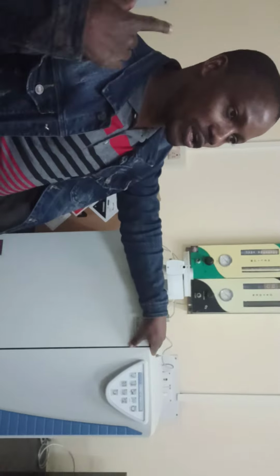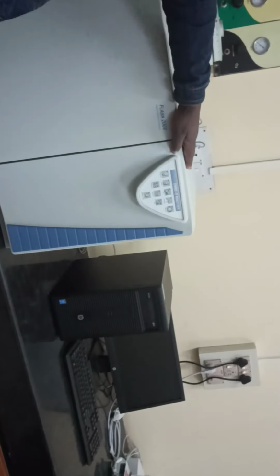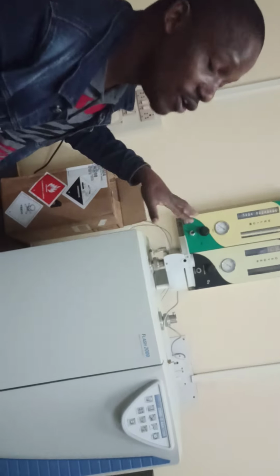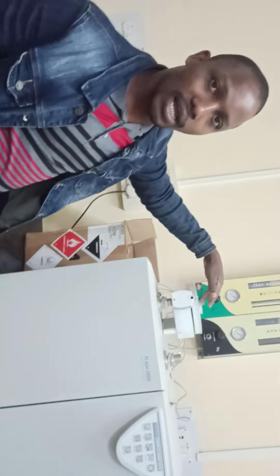Alright. Last time I was showing the nitrogen analyzer. You can see here how it looks, and this is also controlled by a program. It cannot run on its own. There are some programs on my computers which operate this one, which are only attached to the helium and oxygen gases. These are gases which carry materials inside for the process to run. You will find here there are some places where you can place your samples, sample 1, sample 2, up to almost 10 samples per single analysis.